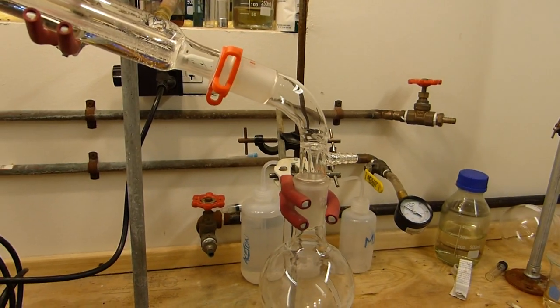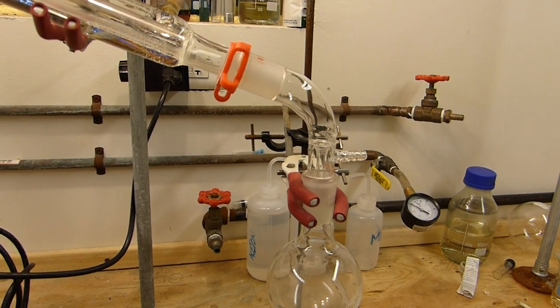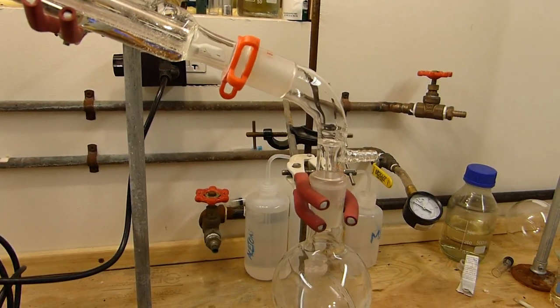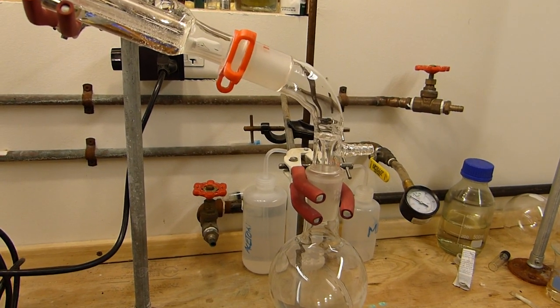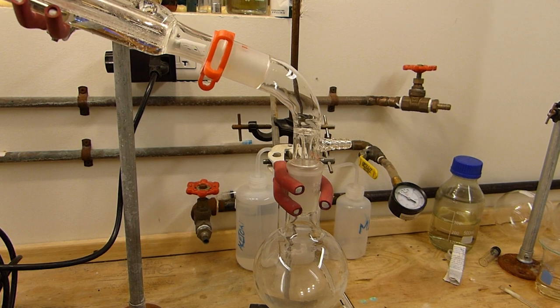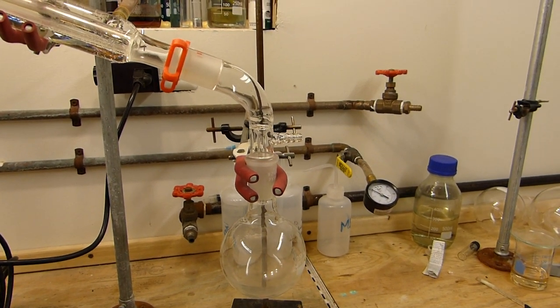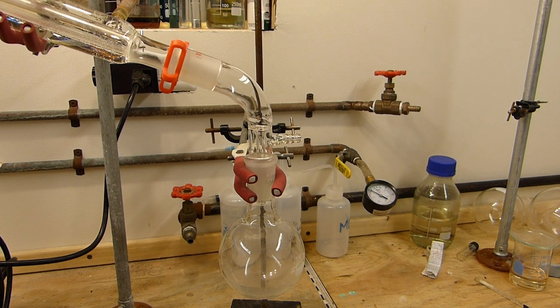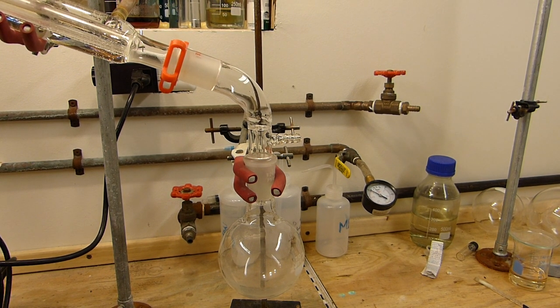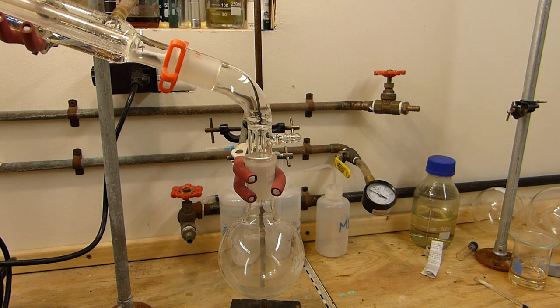At the output pipe here where the CO2 is just being vented to the air and through the hood, if carefully wafted, since pyridine isn't super toxic, the smell of pyridine is definitely detected and it's distinctly terrible. It's like rotten fish slash public bathroom, just a disgusting smell and you can't smell it for too long without wanting to gag. So anyway it's a good sign.